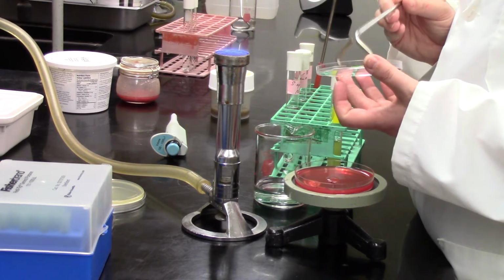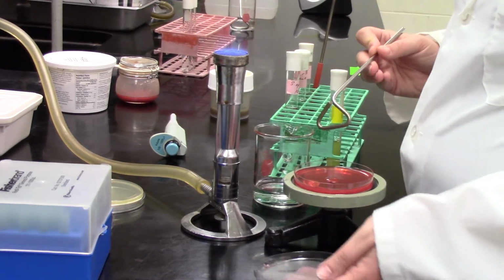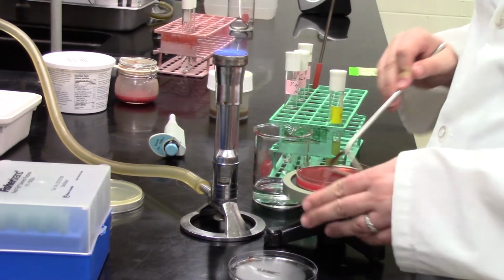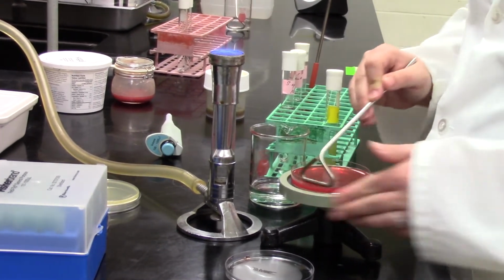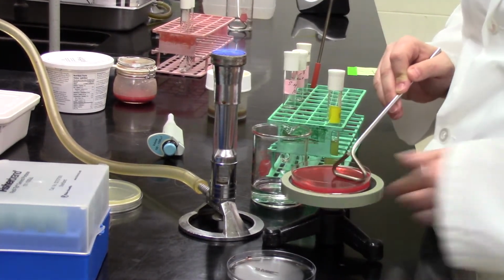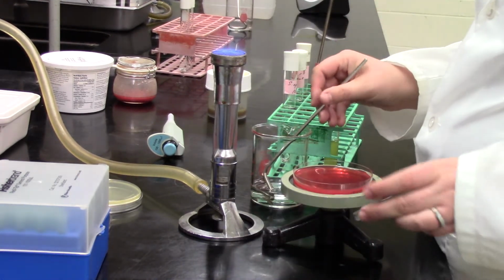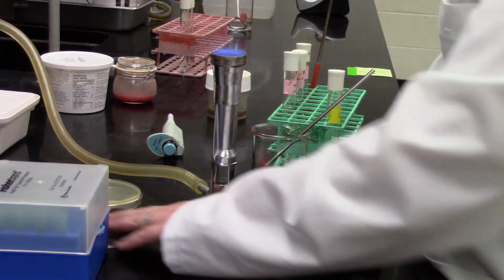Test it onto the lid there and watch. Often if you see a puff of condensation appear on the lid, that's an indication it needs a bit more cooling. Test it on a spot in your plate where there's no bacteria. Once again, if it sizzles or starts to melt the agar, it's much too hot still and you need a bit more time. But it looked good, so Sabrina's going ahead with the spread plate. She's really nicely getting that across there. You don't have to spread forever to have it work well, and the turntable definitely accelerates that too.